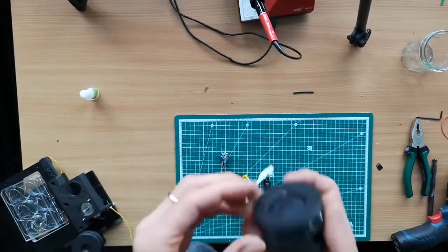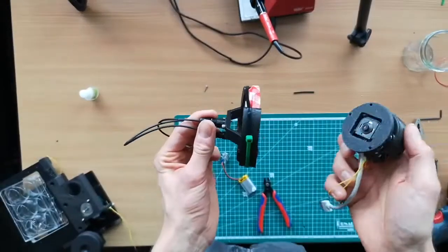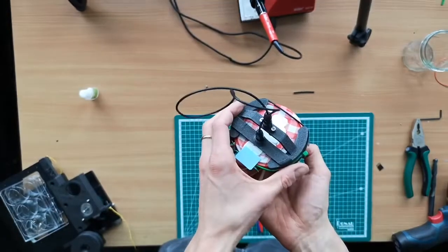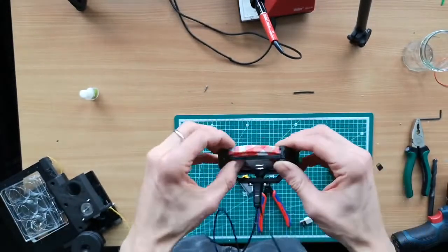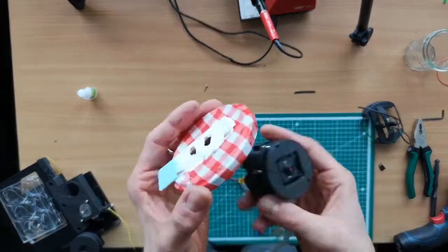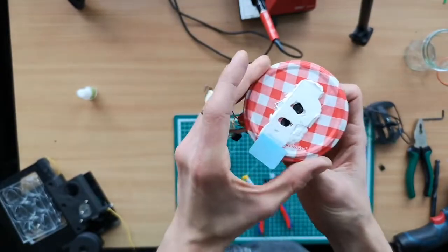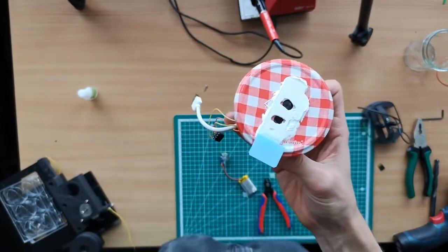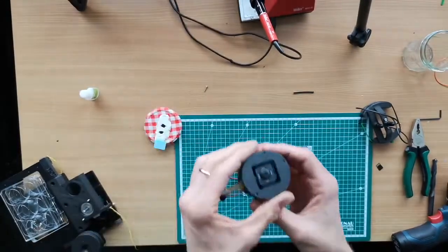And then you're done. And this here, the upper part, still has to be glued in this assembly so that the lens here comes in here. I must admit it would be easier to get rid of the illumination part again, so we just unmount that here. What's important is that the lens here looks through the hole, and the other hole here is essentially going through this hole, and then you're done. So we're going to do that now.